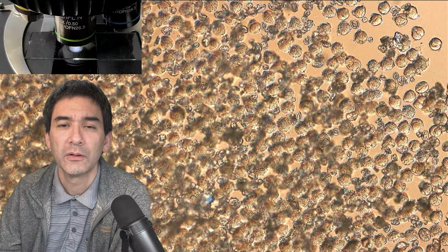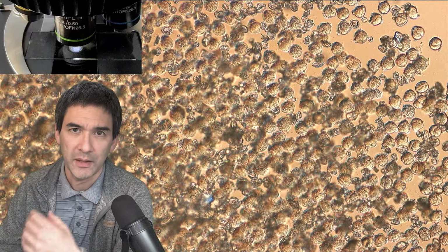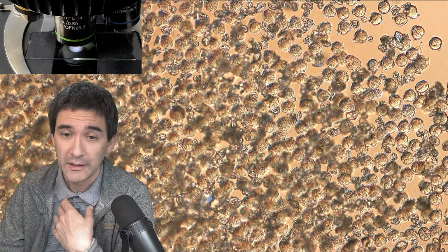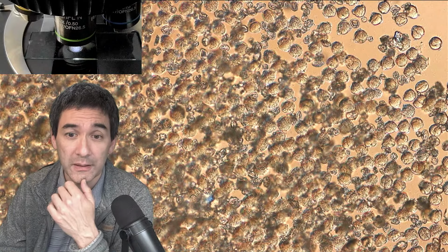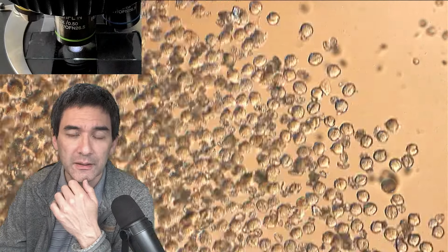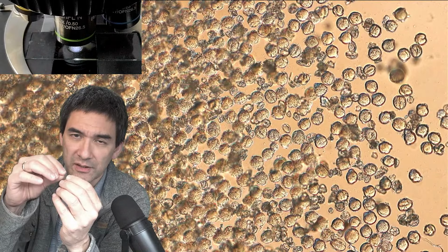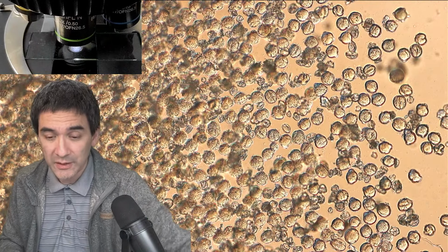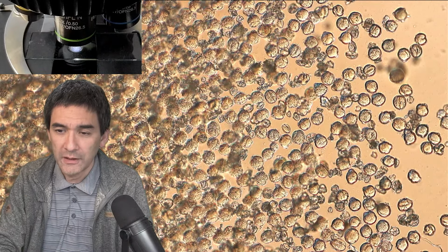So that's basically how it looks. This is without a cover glass because I wanted to make sure enough air reaches the pollen. It's been on here for 2, 2.5 hours maybe, and still nothing's happening. What I hoped is that a small tube would grow out of the pollen, but nothing like that. So for a few minutes, I would like to really go in and observe.